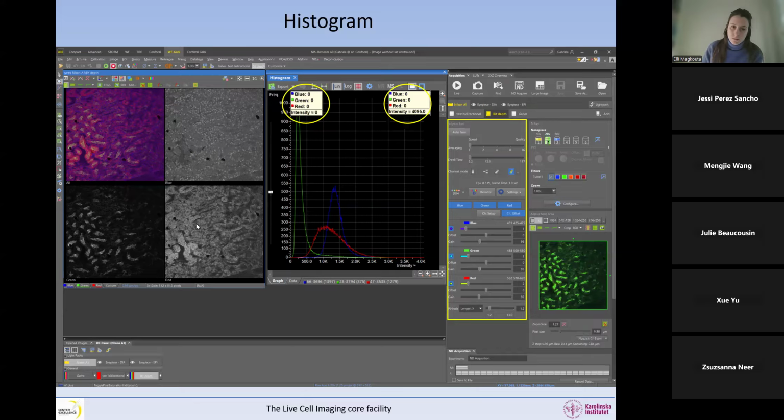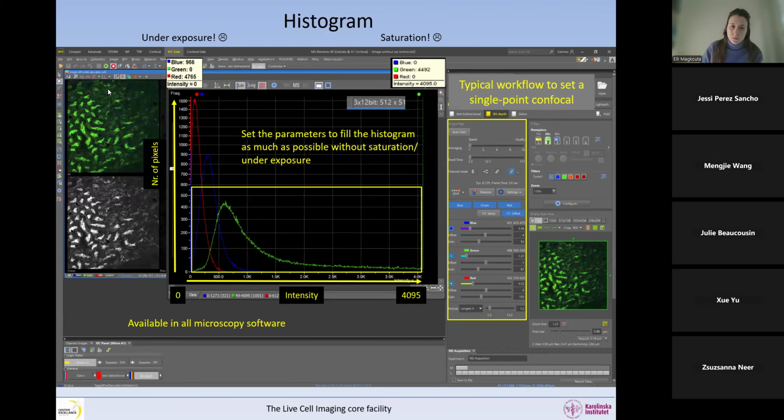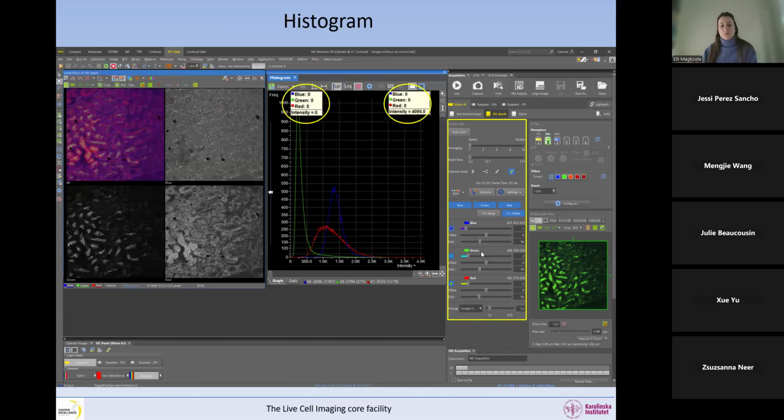And then afterwards, we can do things to help with the image. So I will show you. When we were displaying all the 3 channels together in the overlay and not doing anything with the brightness and contrast, so I've reset the brightness and contrast, they are showing the whole range of possible intensity. We only see the green because that's very bright and the other two are very dim. Now, if we do the same thing after changing, we can see the green, the red, and the blue.